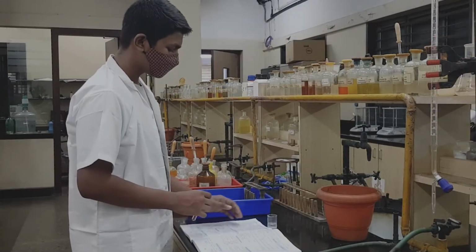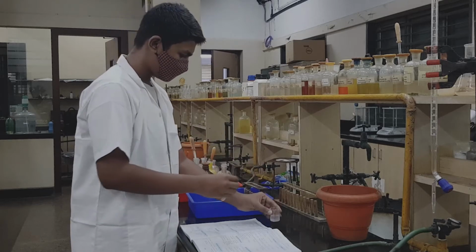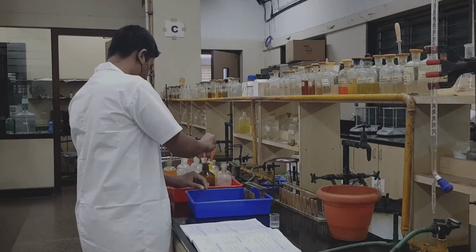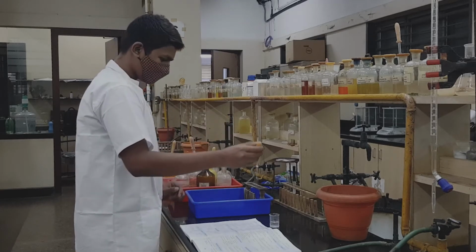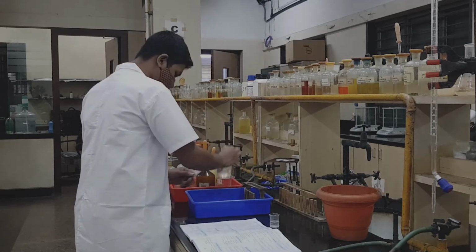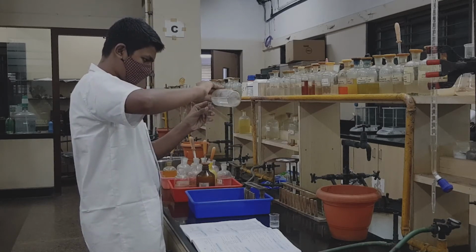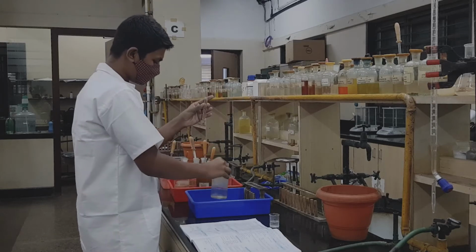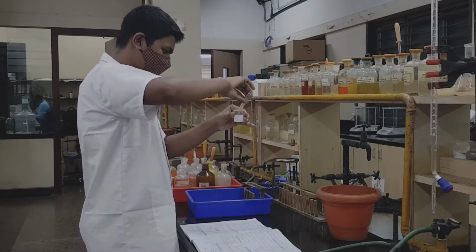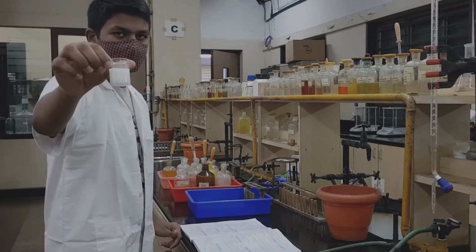Now, to the entire OS, you will have to add ammonium chloride, followed by ammonium hydroxide, and then the group reagent, that is ammonium carbonate, by which you got the white PPT. So, the same reagents with which you got the white PPT, you are repeating with the entire OS. So, you get the white precipitate of group 5.